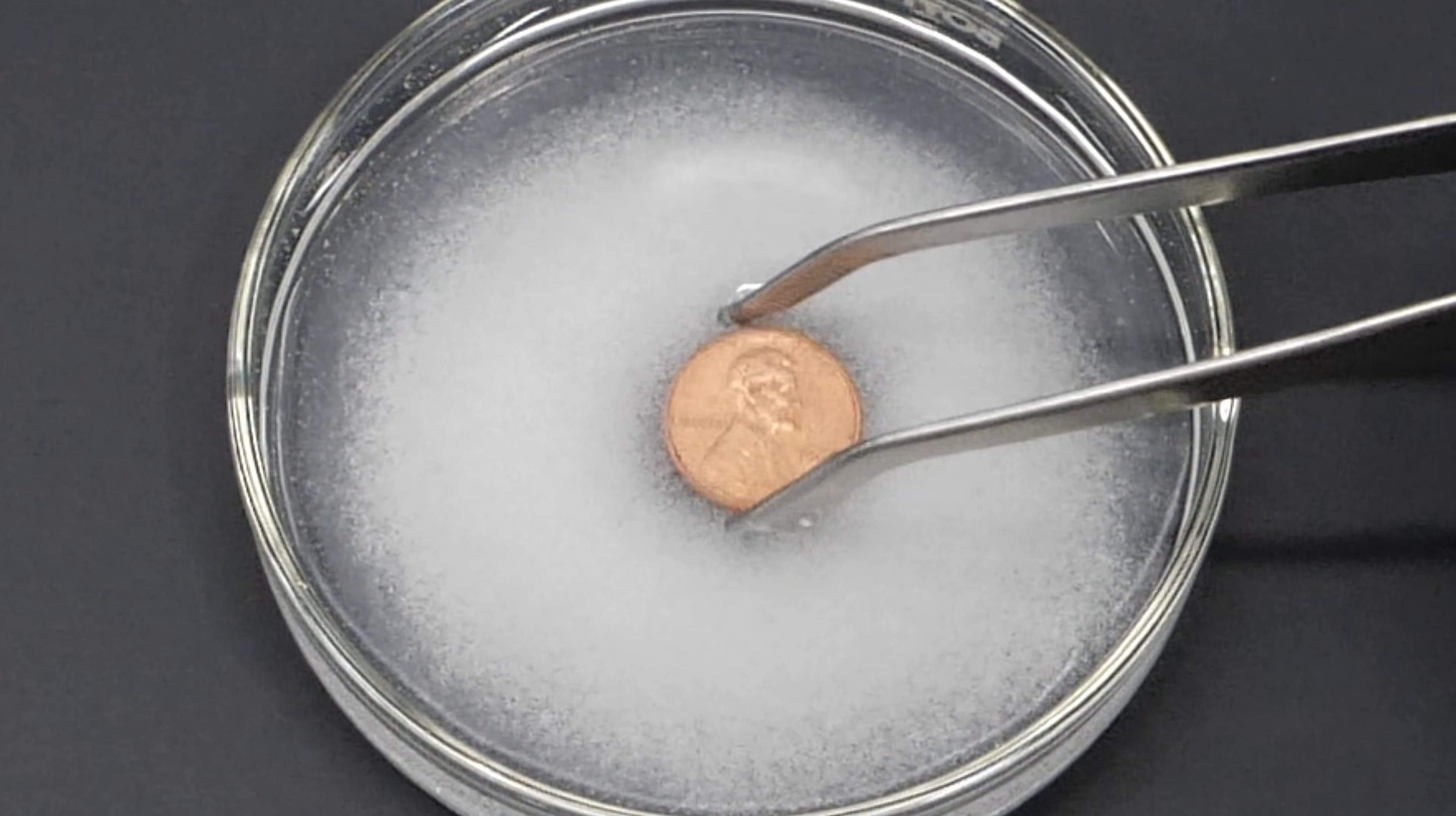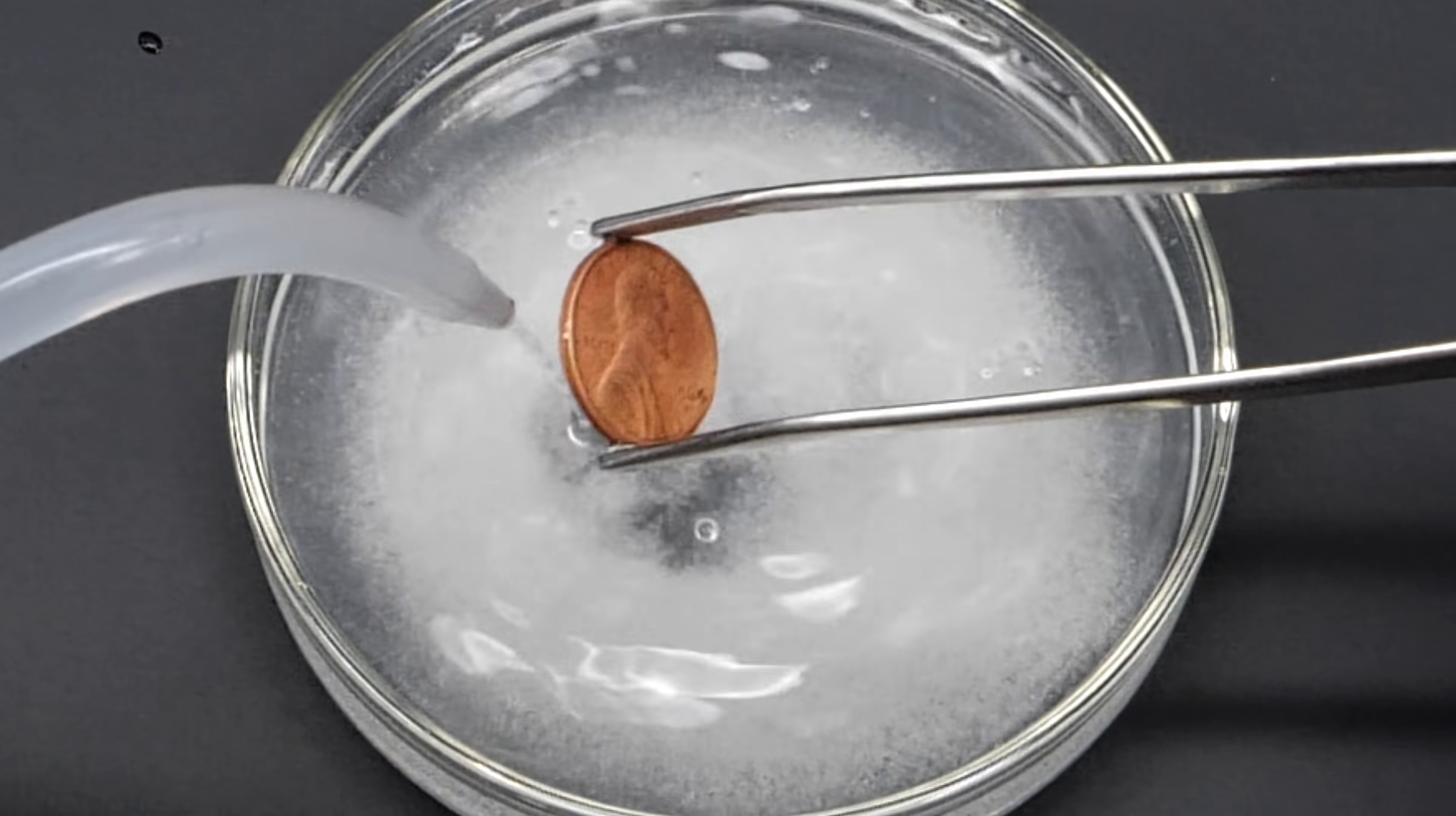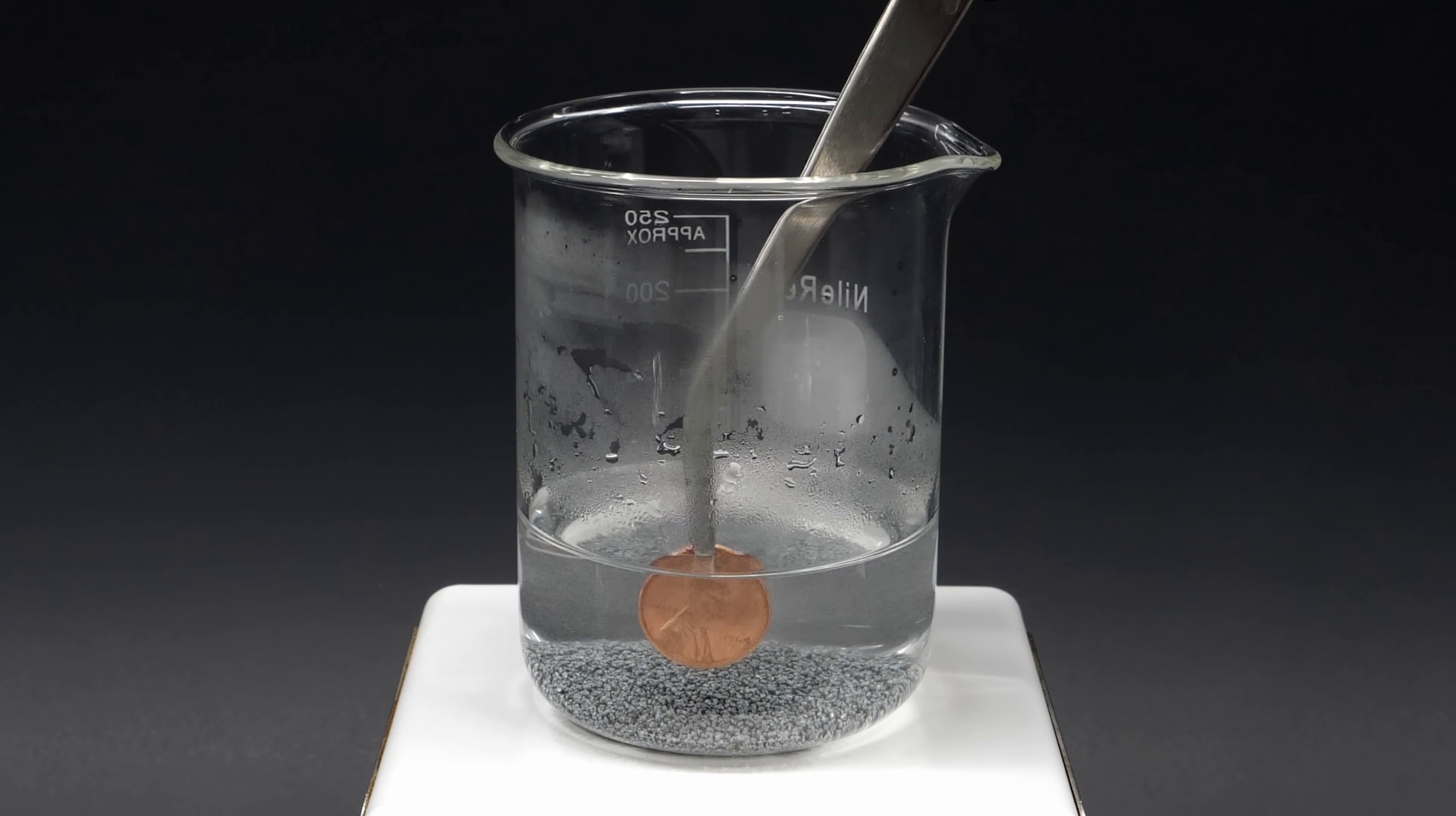Now, coming back to the penny, it's looking pretty good, and I'll just quickly wash it off and drop it into the zinc mixture.